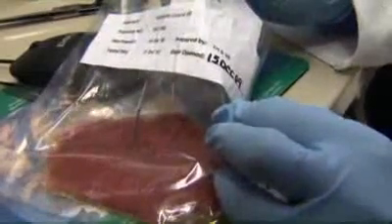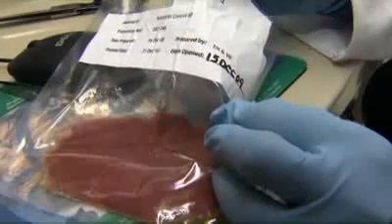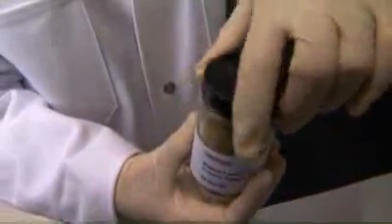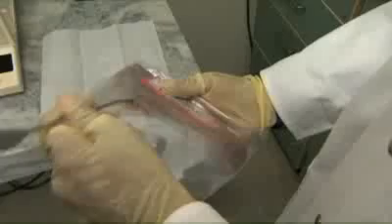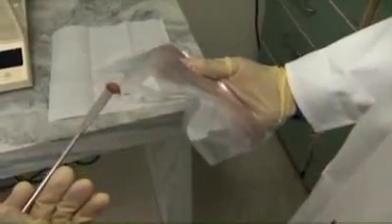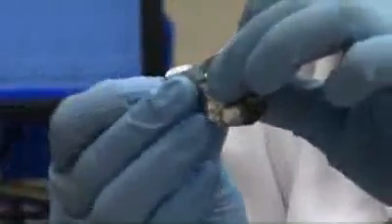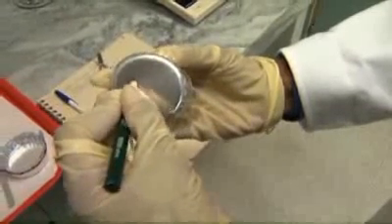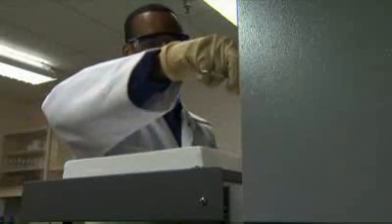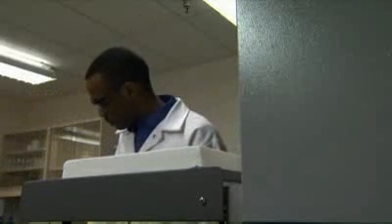Some of the recommended guidelines for good laboratory practices include: take measures to maintain the integrity of the samples throughout the process by limiting exposure to air and non-suitable storage temperatures; wear gloves when handling samples and items associated with the test to prevent cross-contamination. Oil, moisture, or any other material on bare hands can affect the sample integrity, thus resulting in inaccurate data. Keep samples clearly labeled from preparation to disposal. Record observations at the time that they are made. Exercise safety precautions at all times by using the specific safety supplies listed in the method.